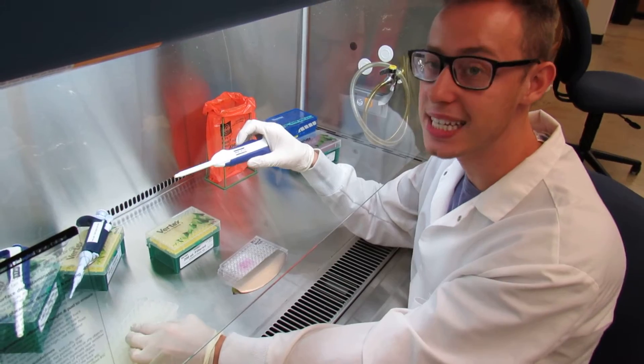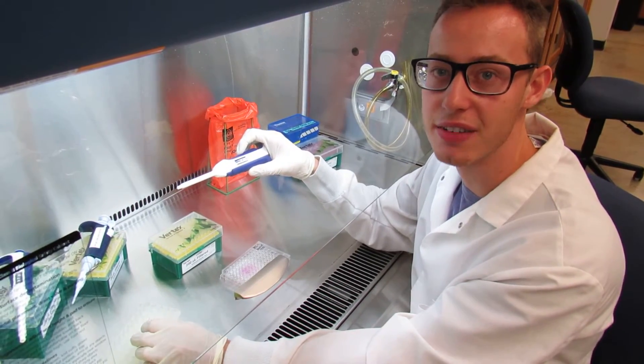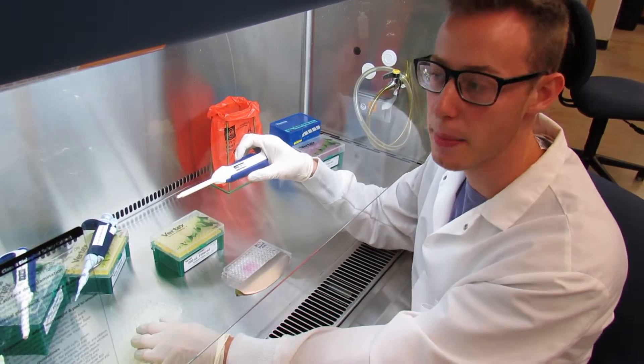This dye is mixed with XTT solution as well as an XTT activating reagent that contains PMS.